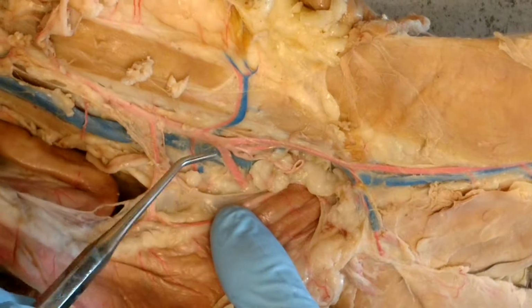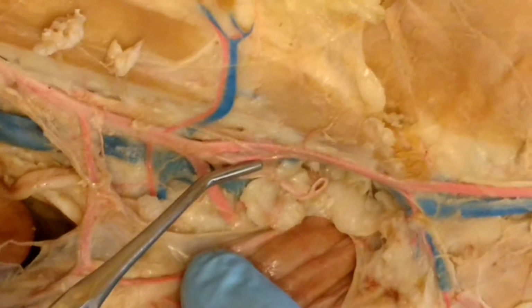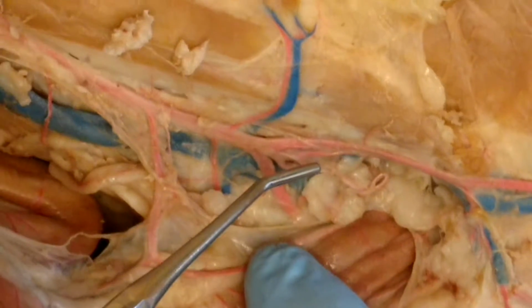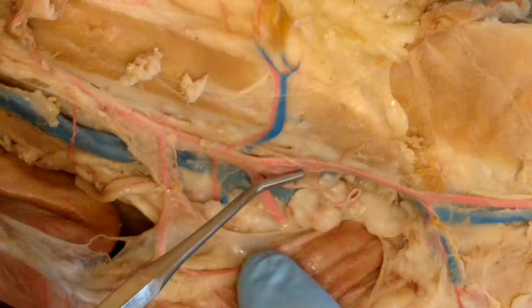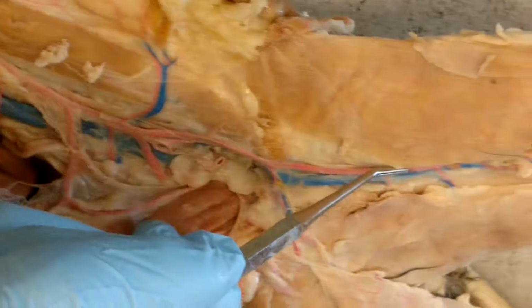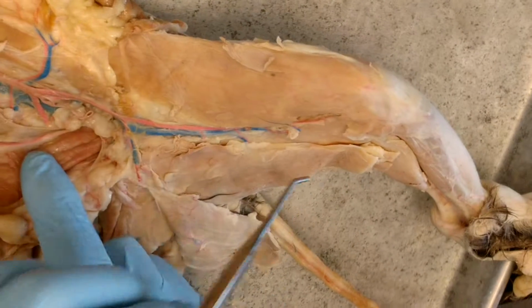In the cat, the aorta splits into external iliacs, a median sacral artery, and then off of that branches the internal iliac. There's no common iliac artery in the cat, okay? So external, internal. Then the external iliac becomes the femoral artery, right? And then it would go behind the knee to the popliteal and then the anterior and posterior tibial, but we're not going to go that far.